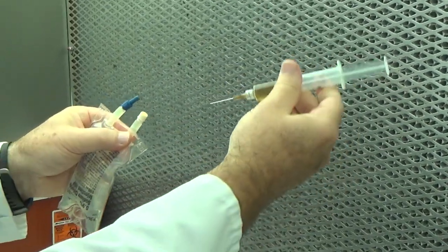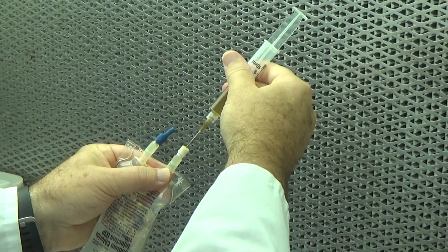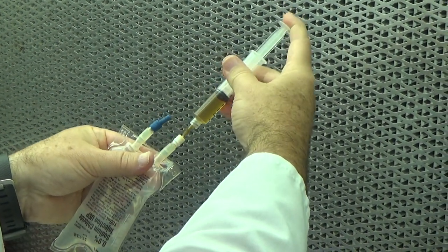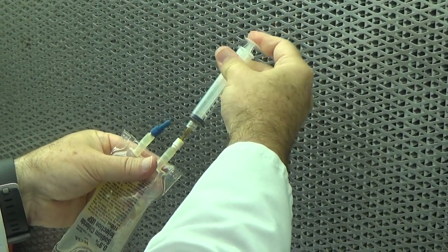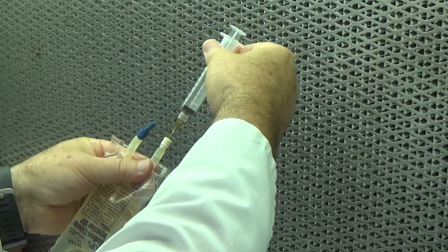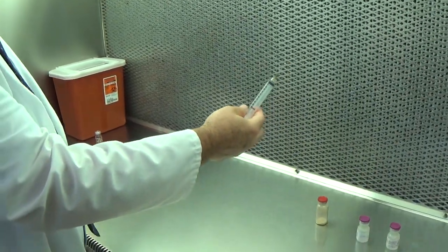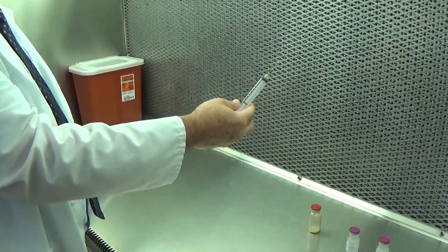And I grab my bag. And at this point, the needle goes straight into the additive site on the bag. And I introduce my drug, or simulated drug, into the bag. And that is just a simple 5 milliliter transfer.